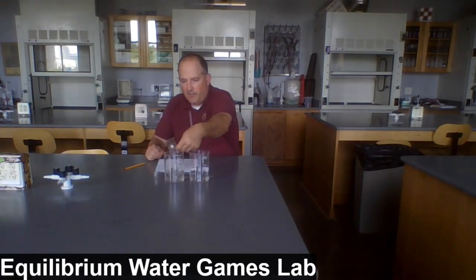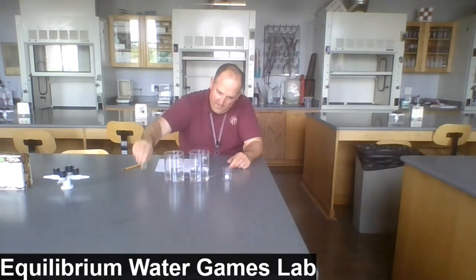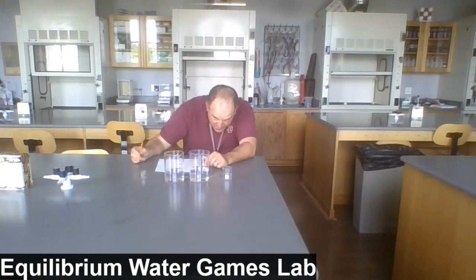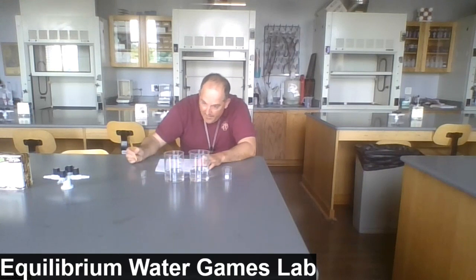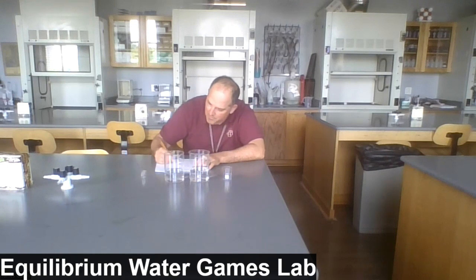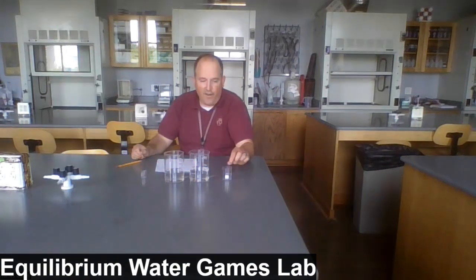Another transfer cycle. I've got now 280 in beaker A and 240 in beaker B. That's after transfer cycle 5.